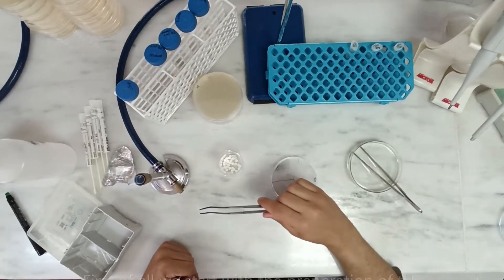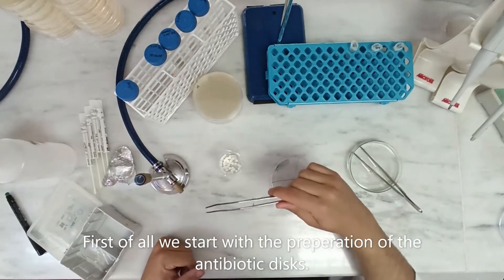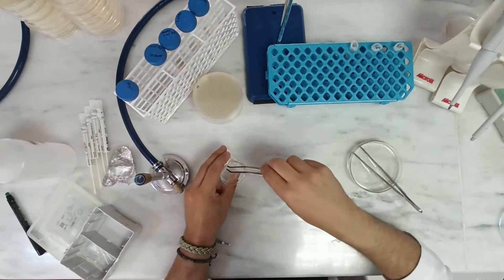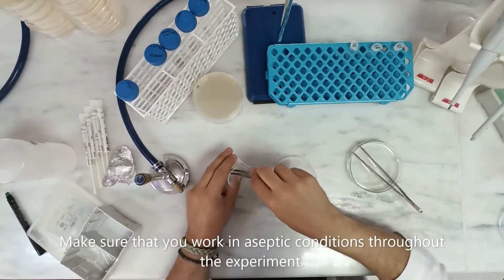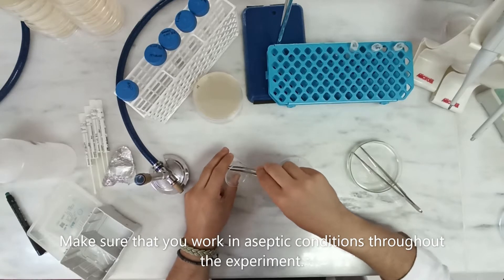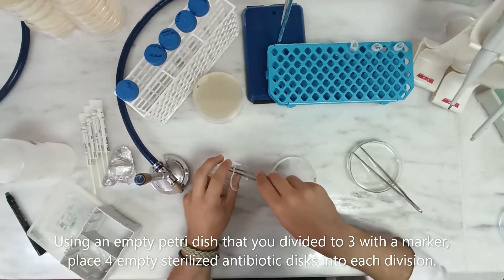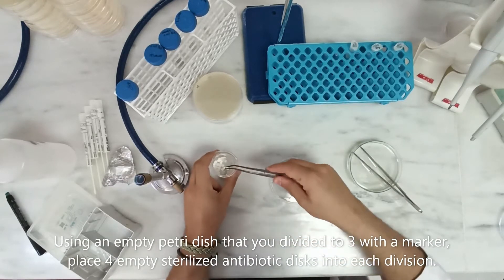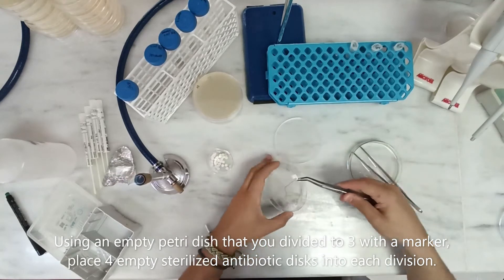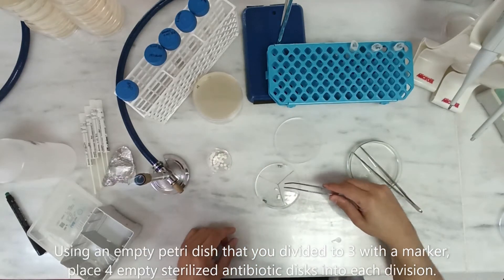First of all, we start with the preparation of the antibiotic discs. Make sure that you work in aseptic conditions throughout the experiment. Using an empty Petri dish that you divided into 3 with a marker, place 4 empty sterilized antibiotic discs into each division.